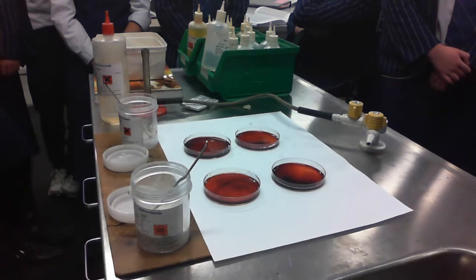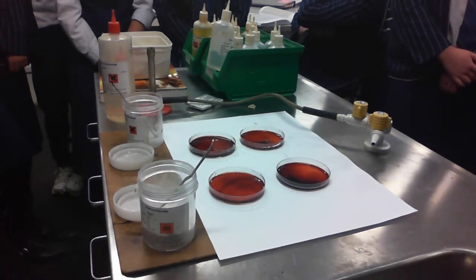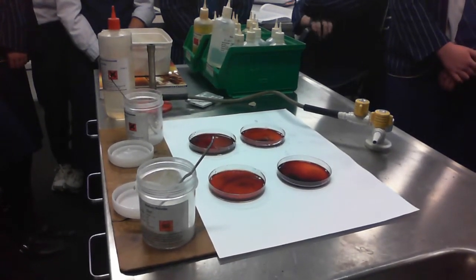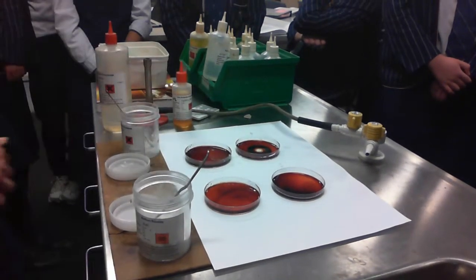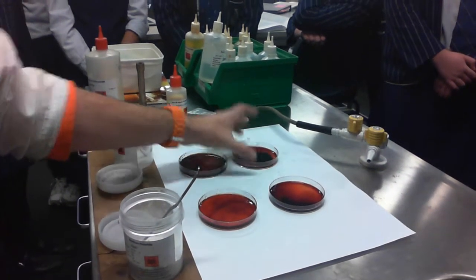Iron 3 nitrate. Okay, so that's one of the reagents on the left-hand side of our equation. So, Gabby, could you put a little bit of iron 3 nitrate in any one of those apart from this one? Yep. How much? As much as you'd like. And we observe that what's happening there? It gets like a dark circle around. Okay, it's got a lot darker.